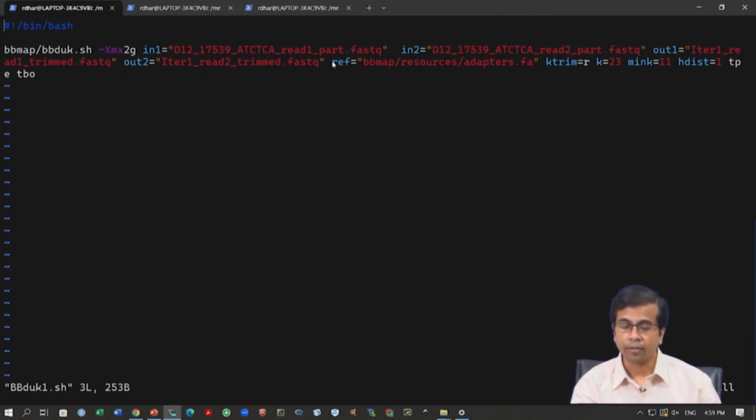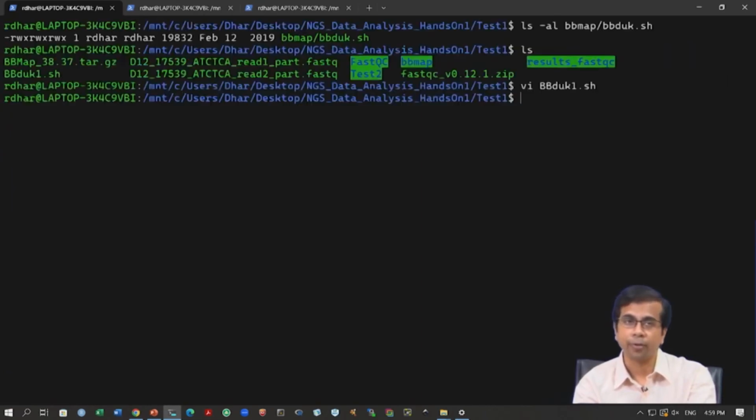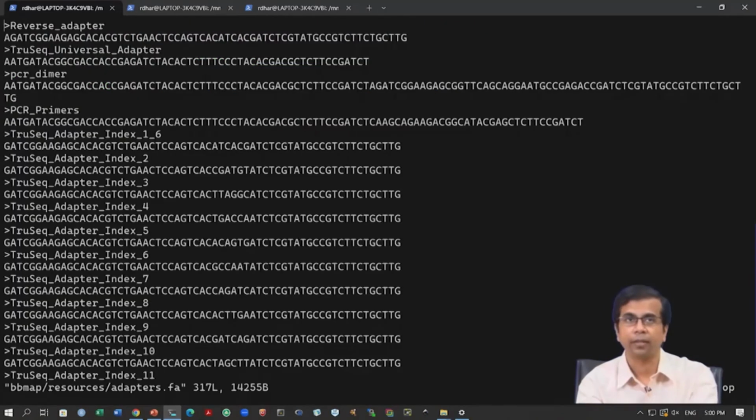Before we run, I also want to see this adapters.fa file. So, let us quit. You remember now the vi editor, :q, we do not want to do any change, we just want to quit. And we want to check this file, it is in this directory, vi resources/adapters.fa. So, this is where the adapters.fa file is, this is in FASTA format, .fa means FASTA format.